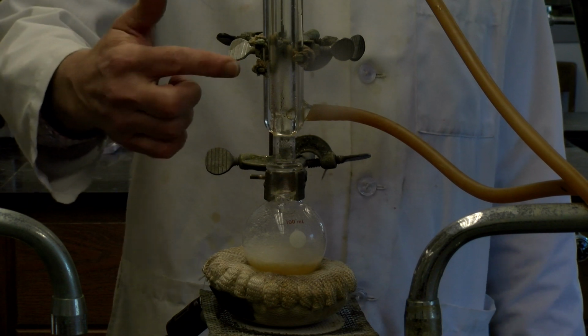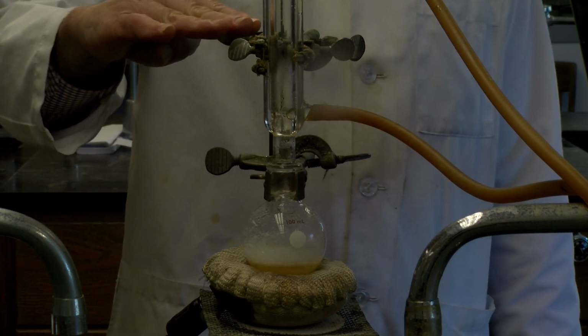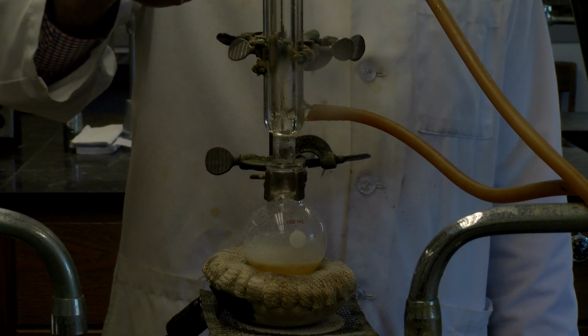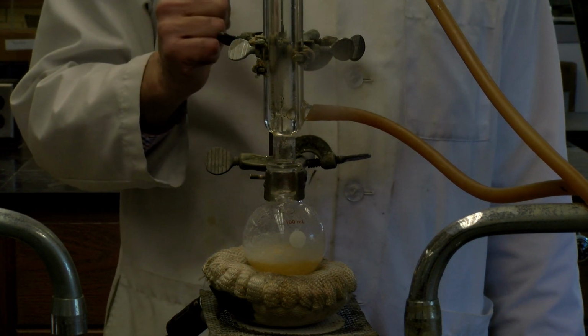And again, we're keeping it down. And so there's usually a condensation ring that occurs. Generally, you want to keep the condensation ring in the lower half. All right, so if it starts getting too high, you can turn the heat down. Because if it starts getting too high, then we'll have the solvent that will be coming out.